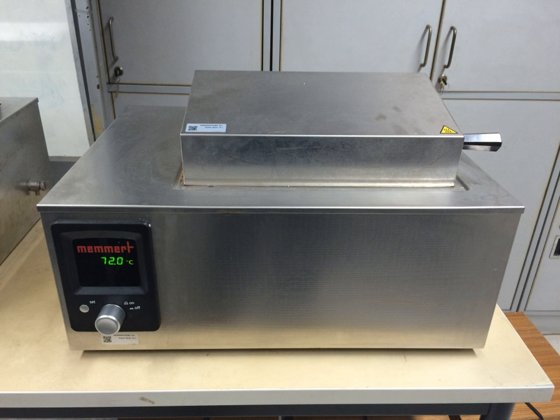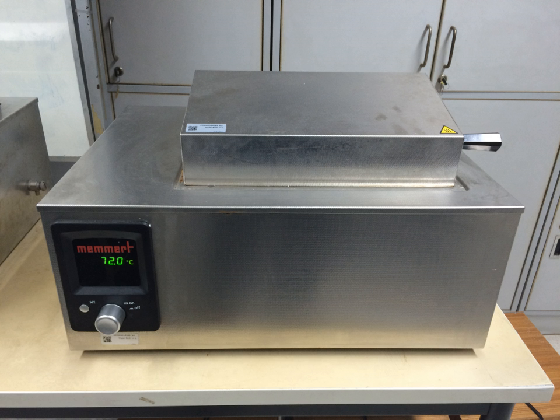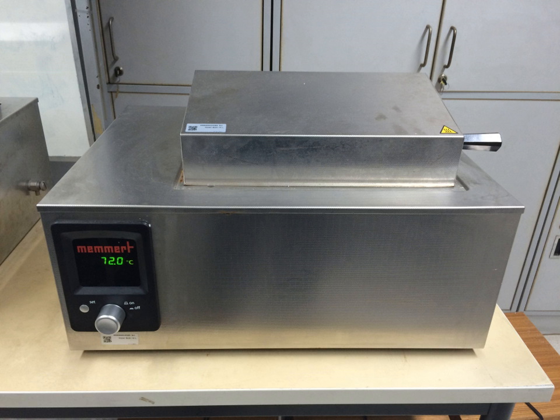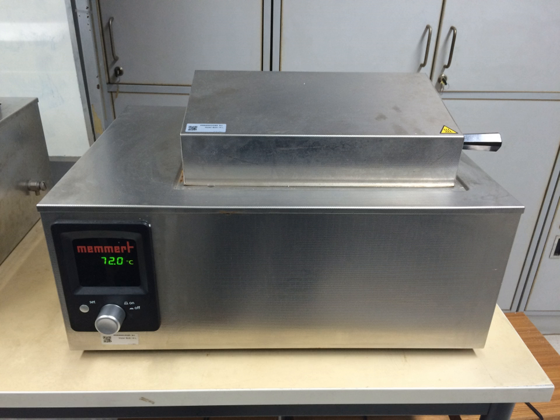If the application involves liquids that give off fumes, it is recommended to operate the water bath in a fume hood or in a well-ventilated area. The cover is closed to prevent evaporation and to help reach high temperatures. Set up on a steady surface away from flammable materials.